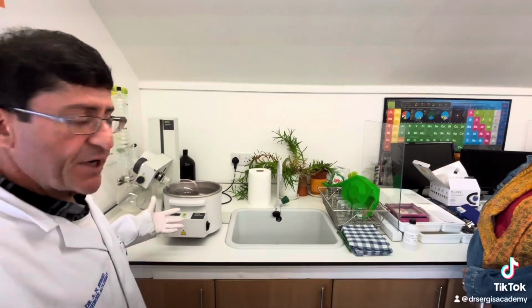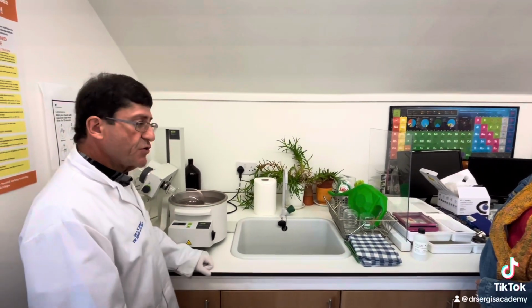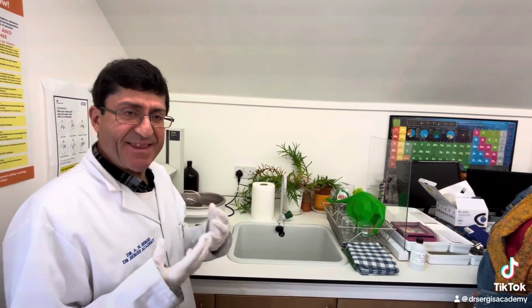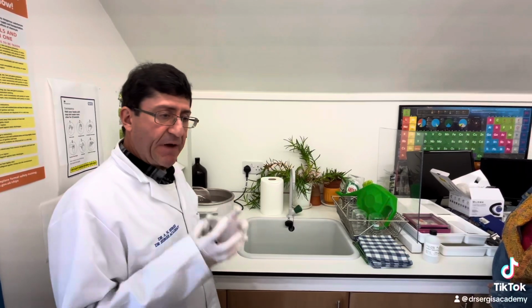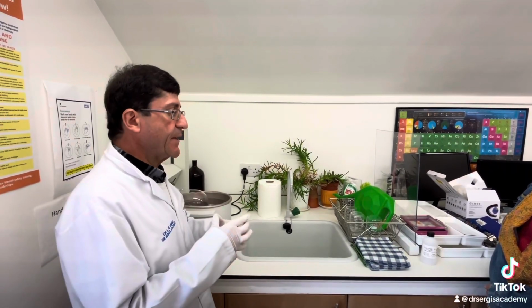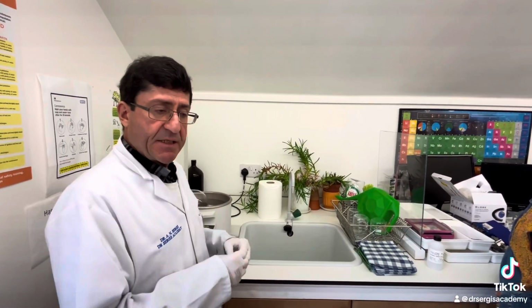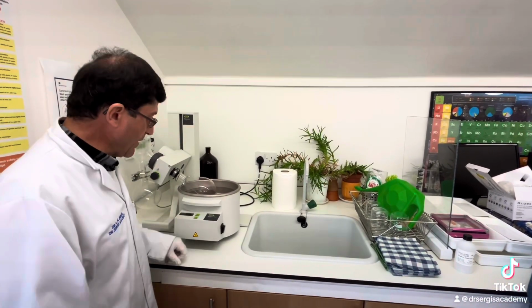Okay, so this is a rotary evaporator, and we use it in industrial laboratories and in universities to evaporate volatile solvents. When we make chemicals as organic synthetic chemistry scientists, pharmaceutical chemicals or indeed any chemical, we need to evaporate the actual solvent that it's dissolved in, in order to get the purified crystalline solid and take it out of the solution to crystallize it. And to do that, we have to evaporate the solvent. For that purpose, we use what's known as the rotary evaporator.